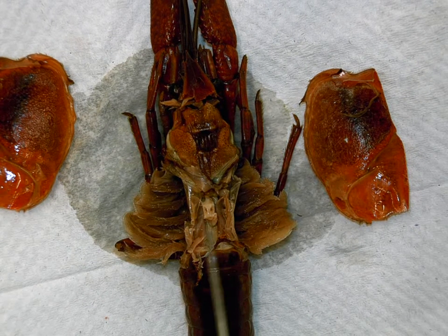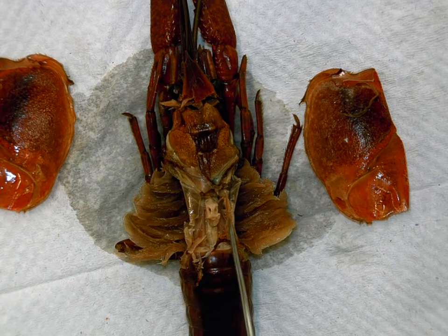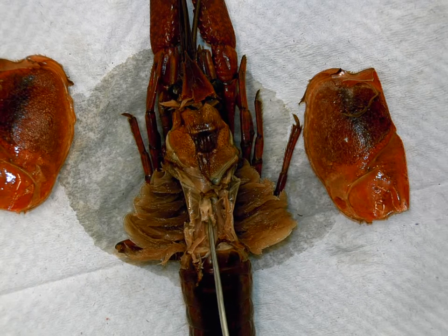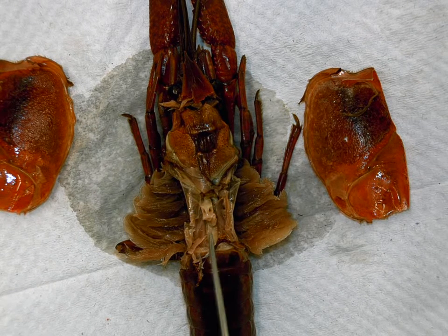Notice there's nothing really attached on either side of the heart, because it sits in an open cavity. The holes in this heart should reveal what kind of circulatory system you are actually witnessing.